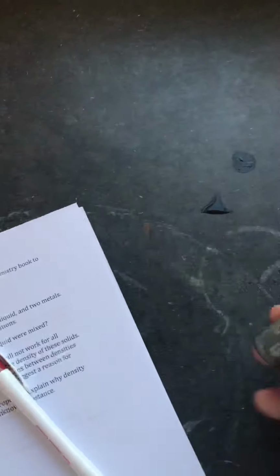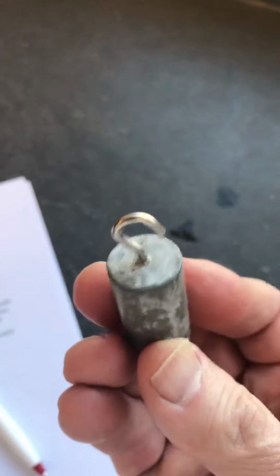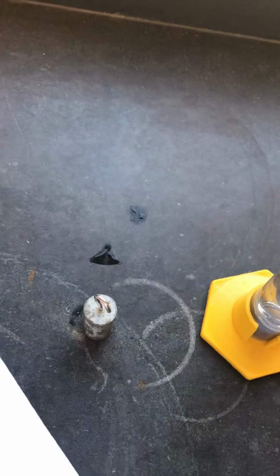I will give you a hint on this since it's your first lab. If you look at this metal, it has a hook on it. And that hook does not look like it's made out of zinc, does it? And the lead, which is sitting at the bottom of this beaker right here, also has a relatively large hook on it compared to the size of the metal itself. I doubt that hook is made out of lead, and I doubt this is made out of zinc. That looks like it's made out of steel, a different material. Lab errors, huh? Okay, well, maybe that's one.